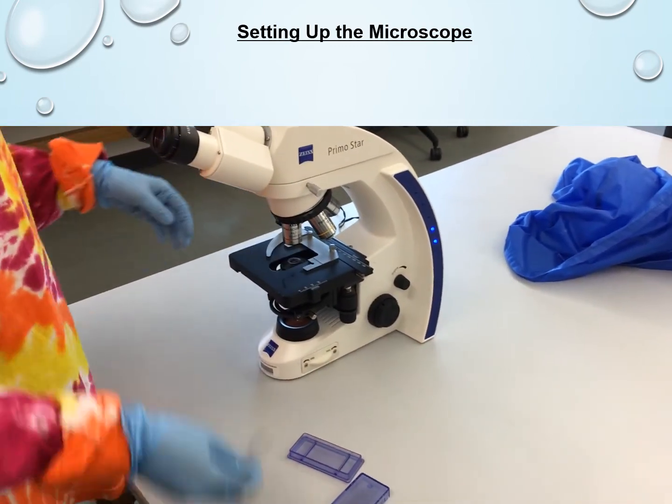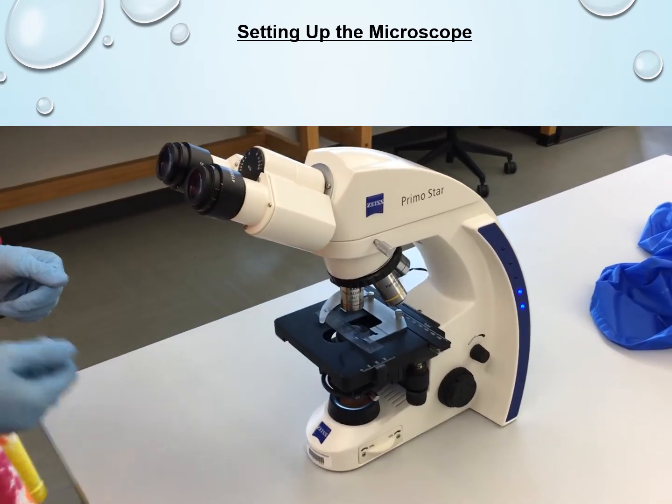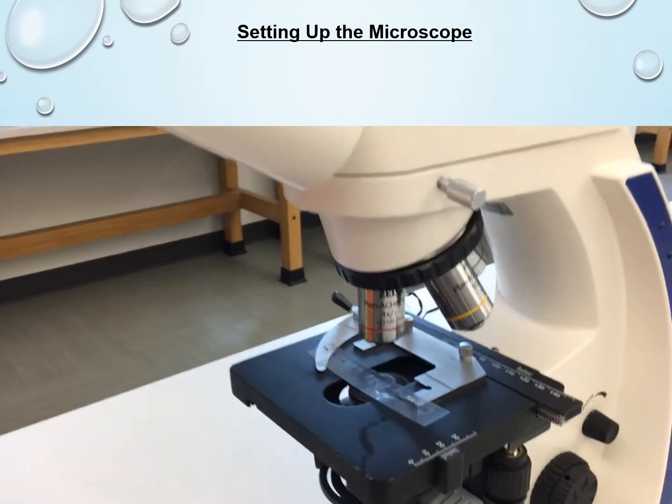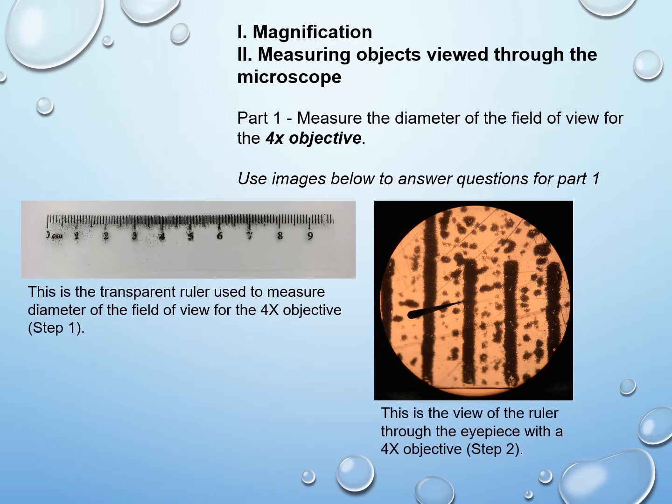The other device you'd be using in this lab is this little ruler. The ruler is not a proper slide, so that one just sits on the stage without being held in position properly like a normal microscope slide would be, though you can tuck it under the lever. You just need to place it so that you can see the little tick marks underneath as you look through the eyepiece.